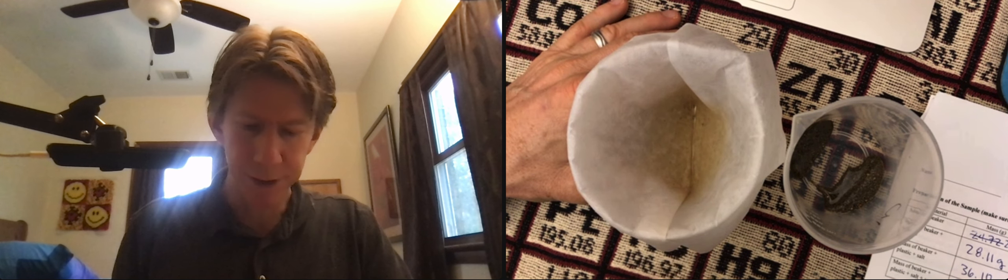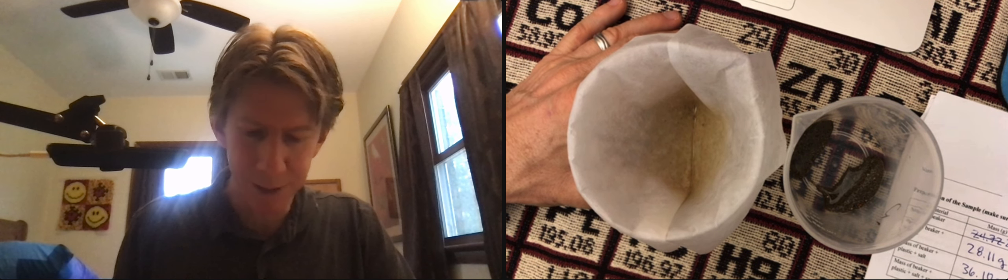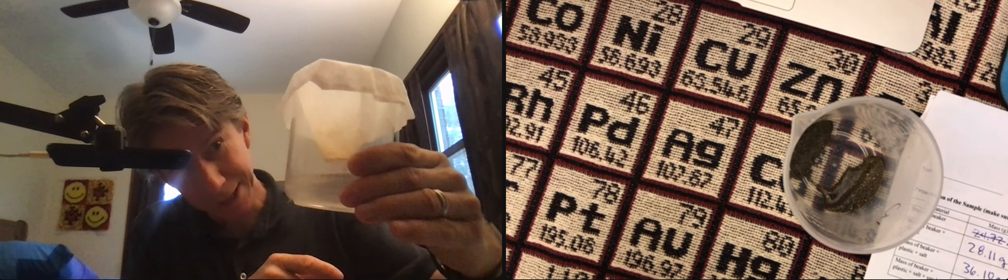It looks like I've got very little, if any, just a tiny bit of solution still in there. And if you look, I've got my solution, my filtrate now down here. It's not touching anything, although it's getting close on one side.